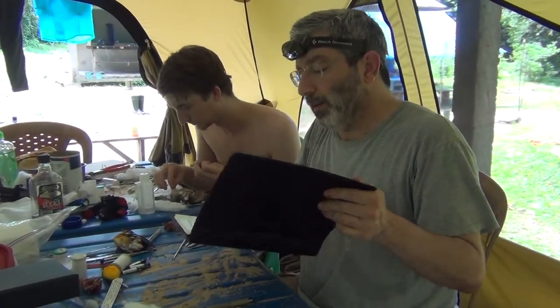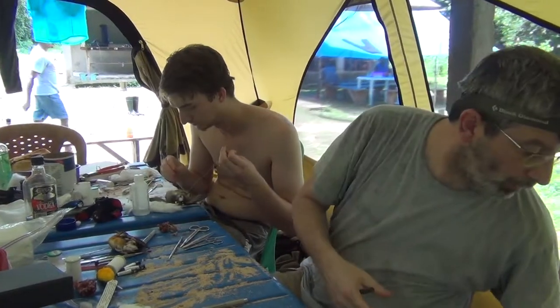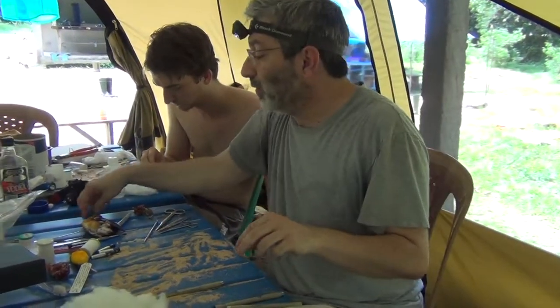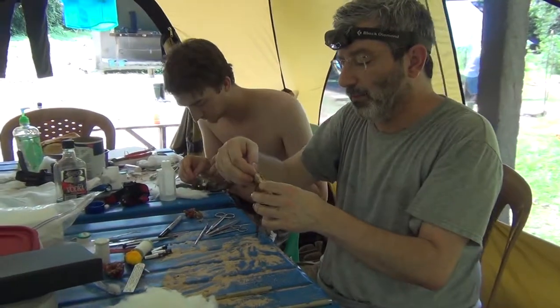So with that, the catalog is complete, the label is ready, and I can concentrate on finishing skinning this bird.